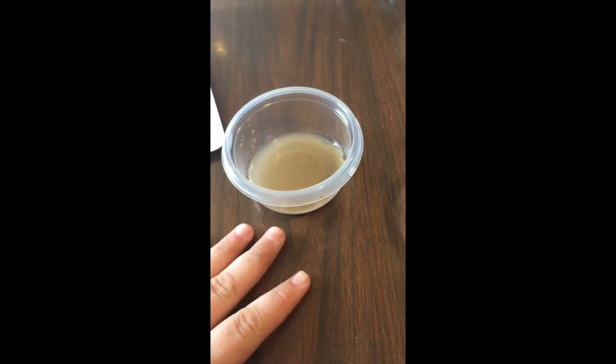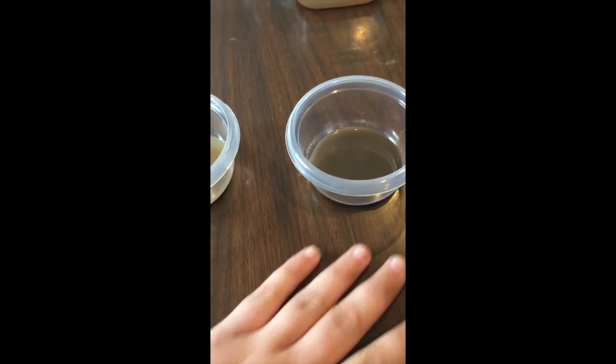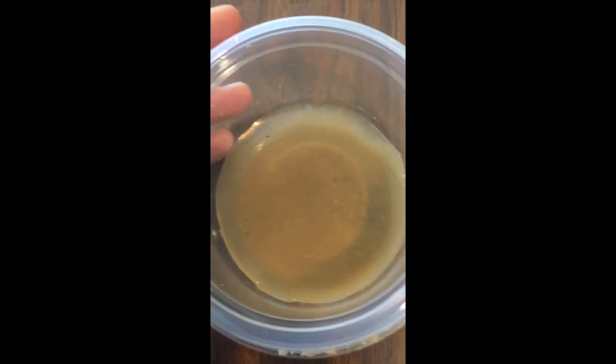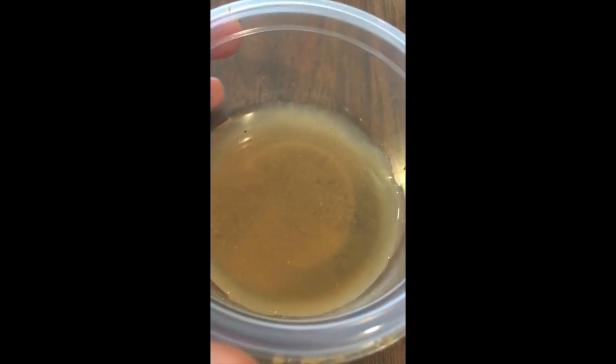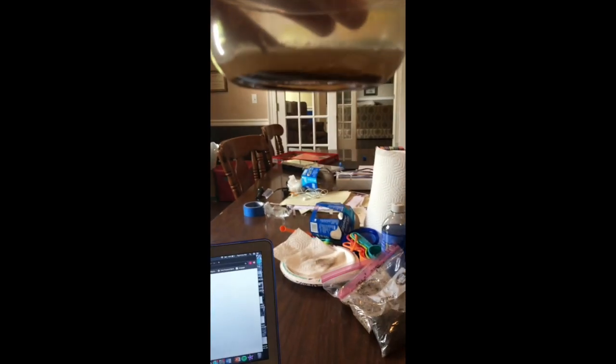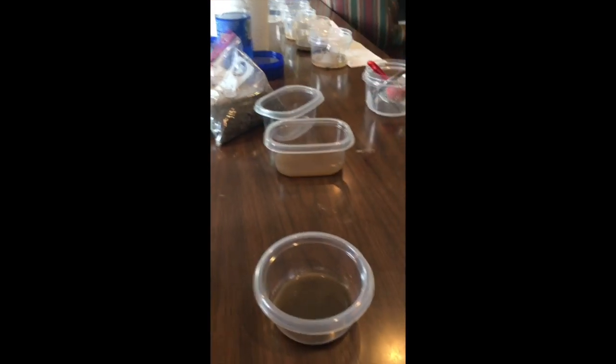And you can see right here is still the forest, right here is still the field. You can definitely tell because of the different colors of the water, and you can definitely tell right there the sediment in the bottom. And if I lift it up slowly, you can definitely tell from the bottom. You can tell how much sediment's in there, and you can definitely tell from that angle too. And I'll be providing measurements in the paper I have to go along with this.